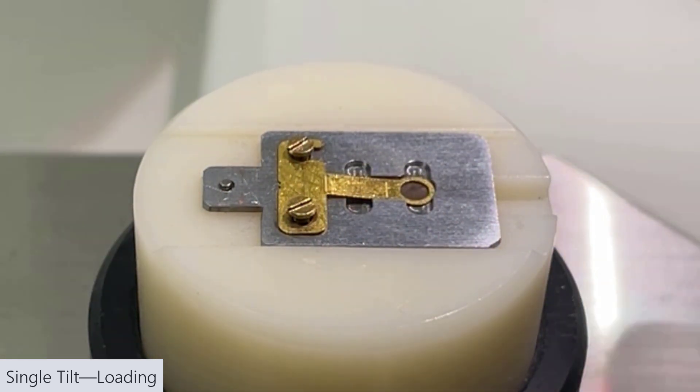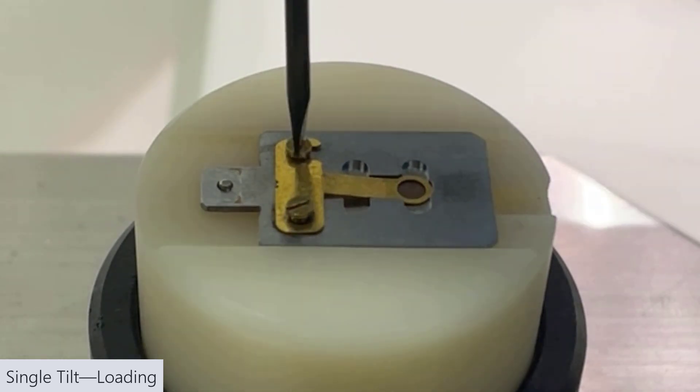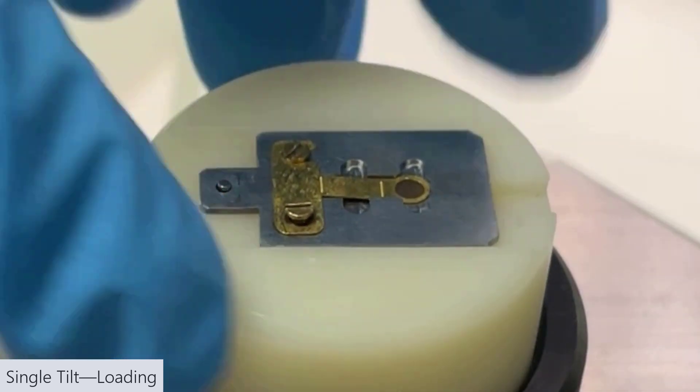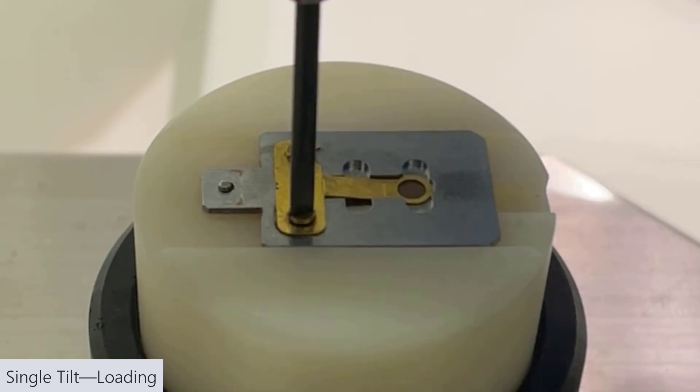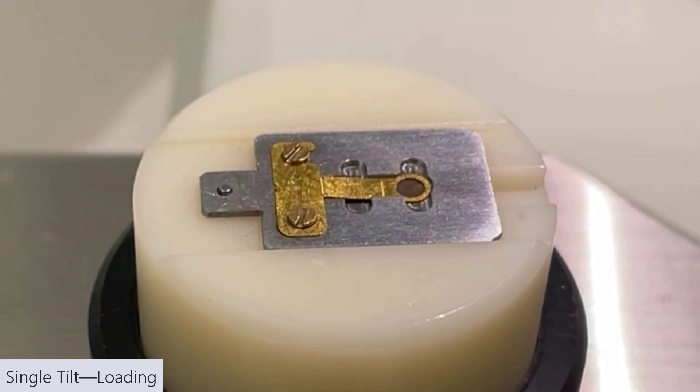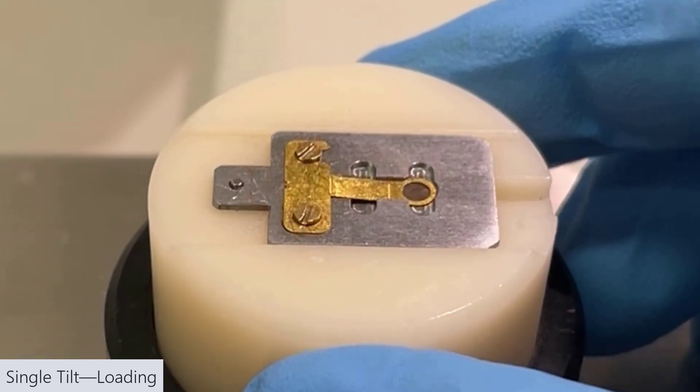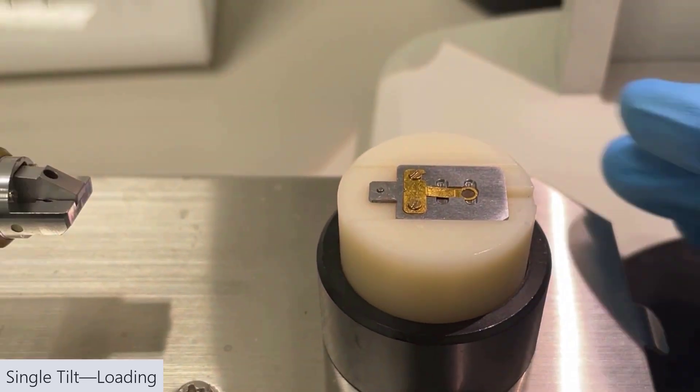Make sure it's seated properly. Screw it back in, being sure not to over-tighten. It's easy to over-tighten these, so try not to do that. Now we need to put the blade into the holder itself.